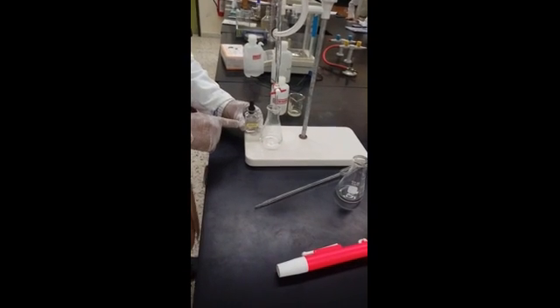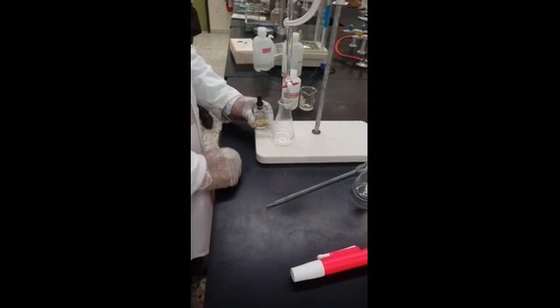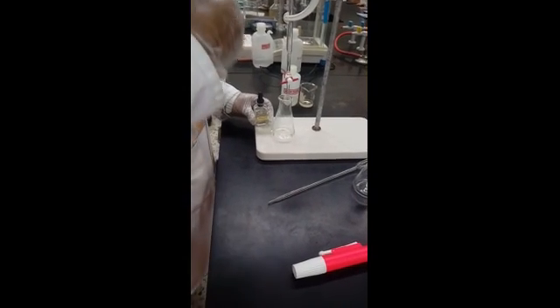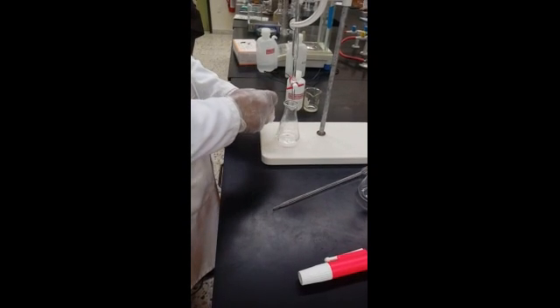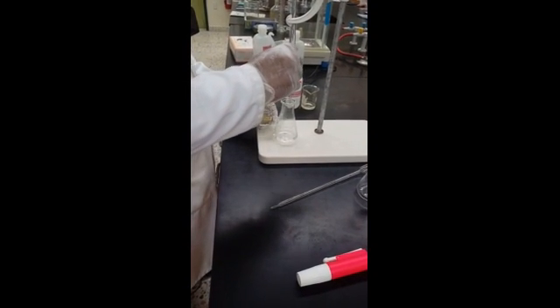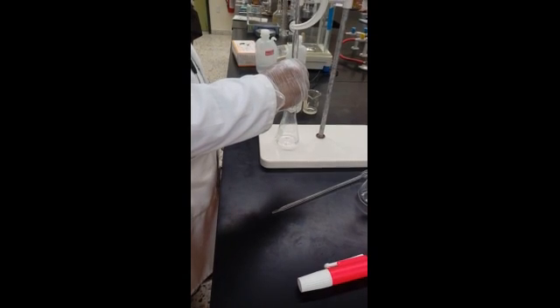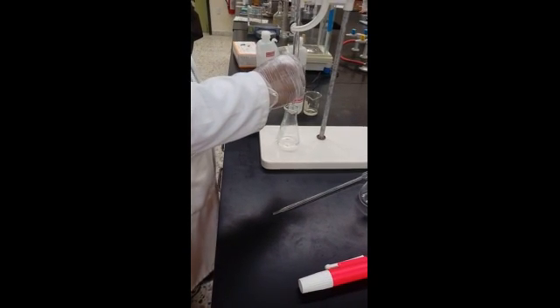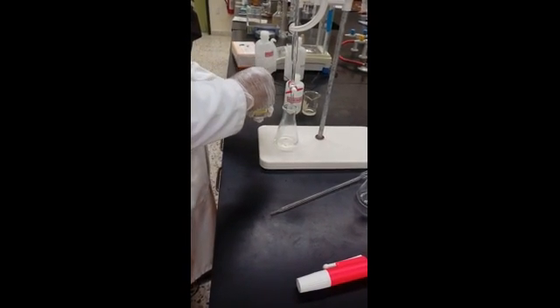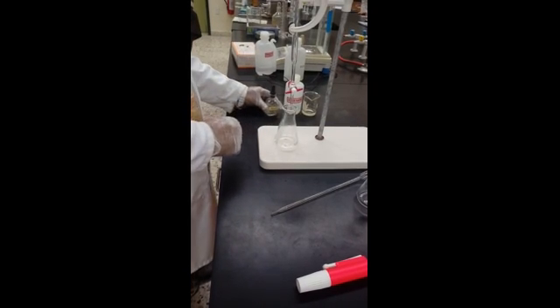Now you have to put indicator, 3 drops. Did we do indicator for that practical? No, because it has self indicator. But here we don't have indicator, so we must add indicator. We are adding phenolphthalein indicator, 3 drops, to the acid. And it does not give any color. So that means the phenolphthalein indicator has no color in the acid.